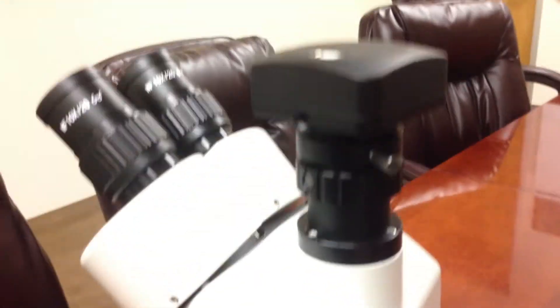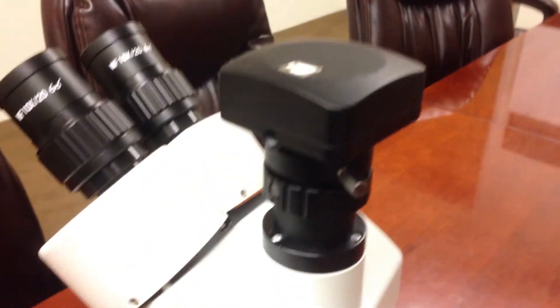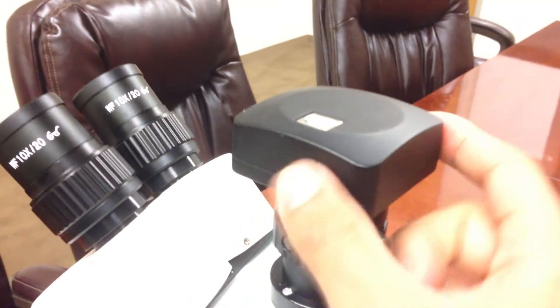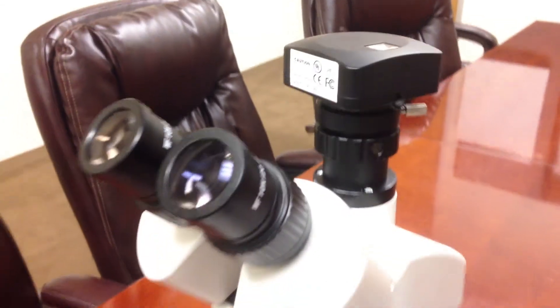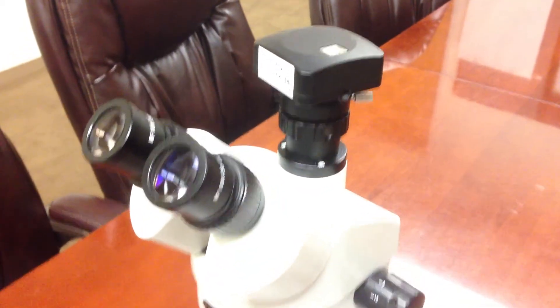You have the AD-C20 attached to the MU series camera. But again, this will also work for the MT and MA series camera. All right. You guys have a good one.